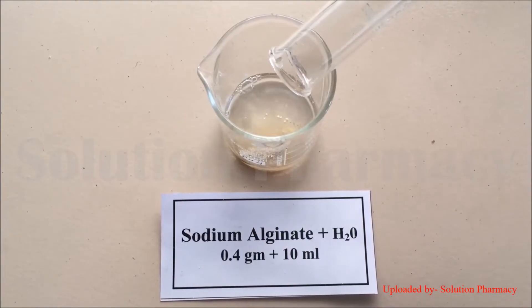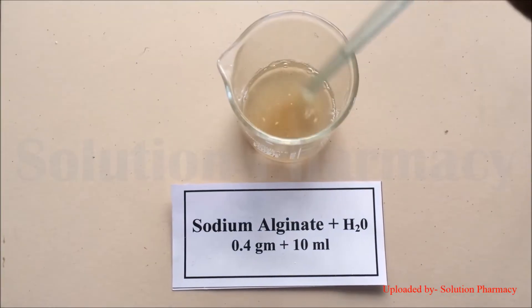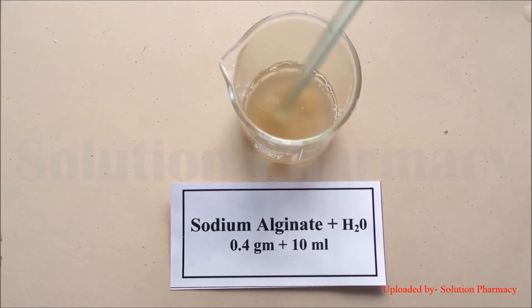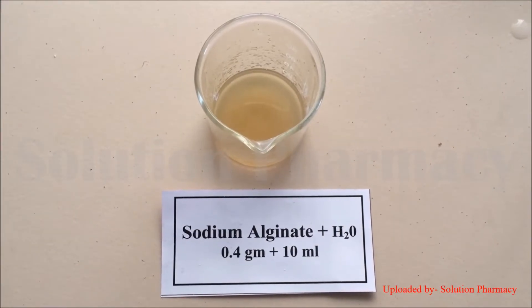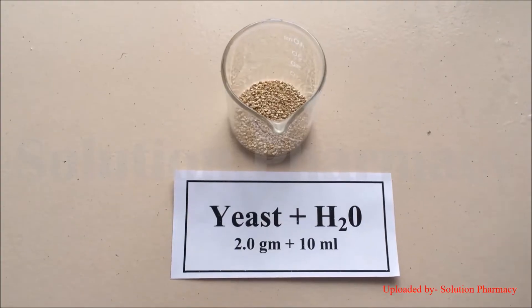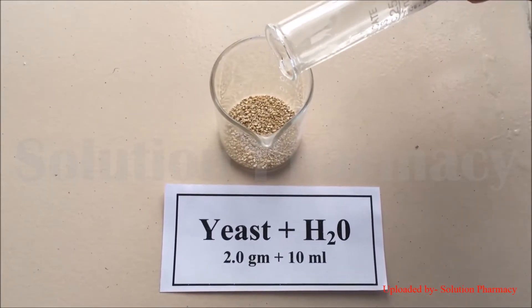After weighing all the ingredients, let's start the experiment. First, add the 0.4 gram of sodium alginate into 10 ml of distilled water in a beaker and, with the help of a glass rod, dissolve the sodium alginate in the water. Now the sodium alginate solution is ready.